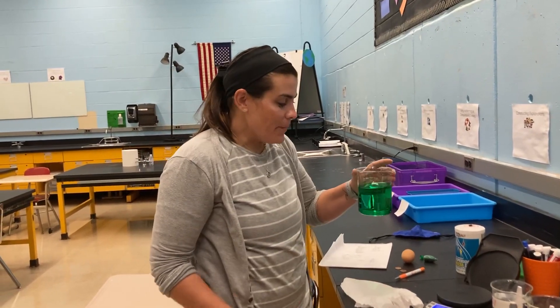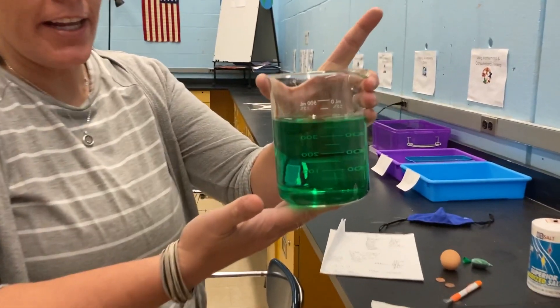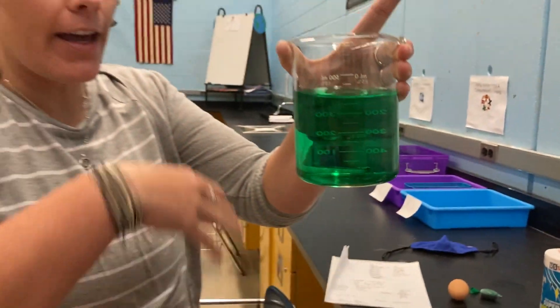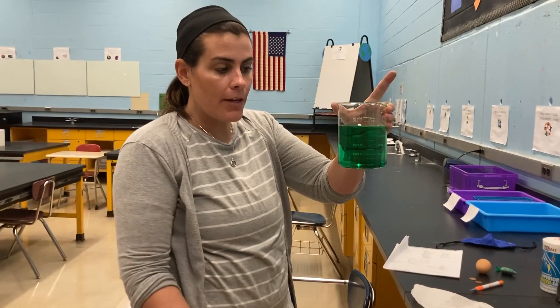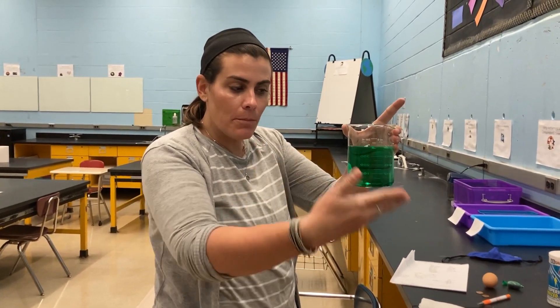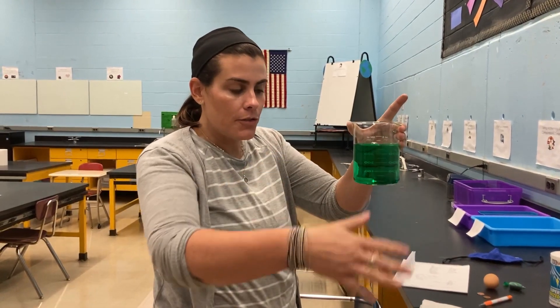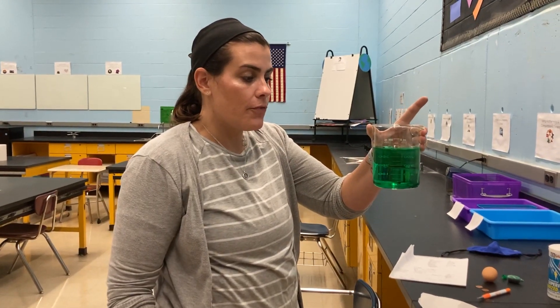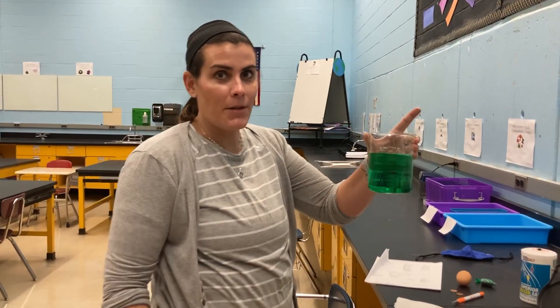All right, it's been 10 minutes. First I wanted to take a look at our food coloring in the beaker. You can see that the food coloring particles have evenly diffused throughout the beaker of water. Important thing to note is that everything is still moving in here — it's just at equilibrium. We've reached a balance between the food coloring particles and the water particles, and we call this equilibrium.